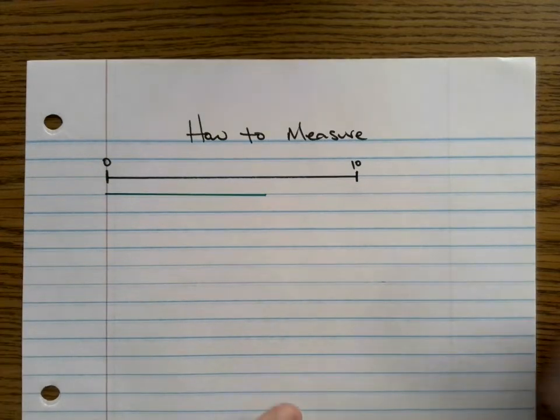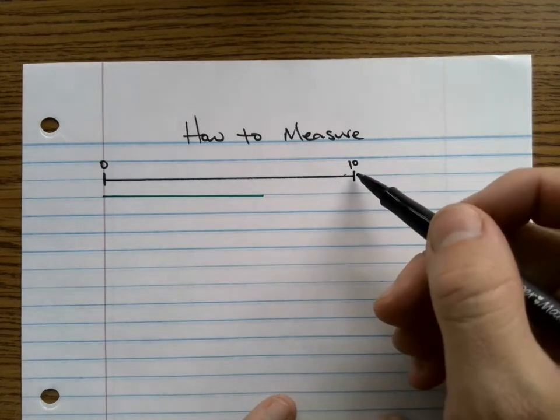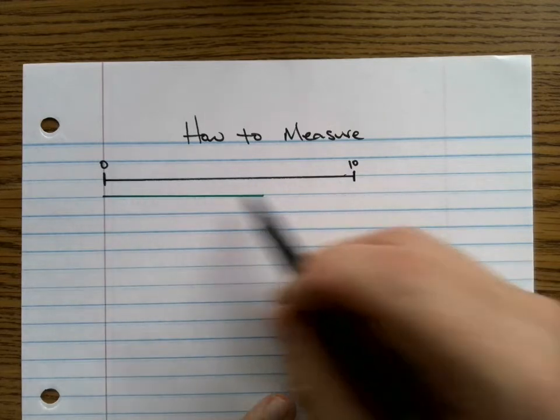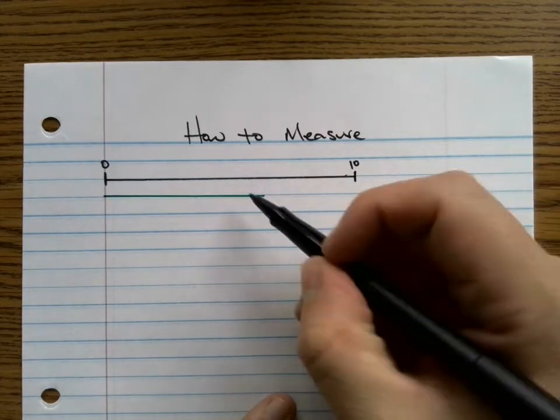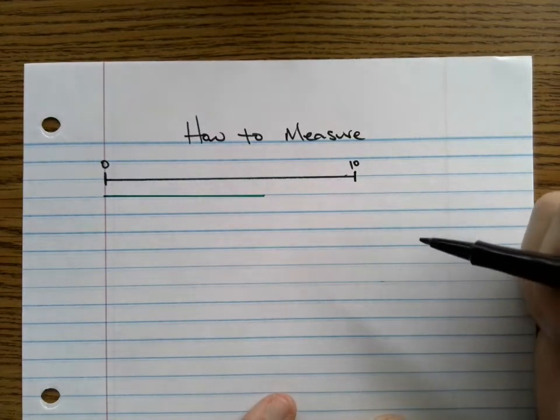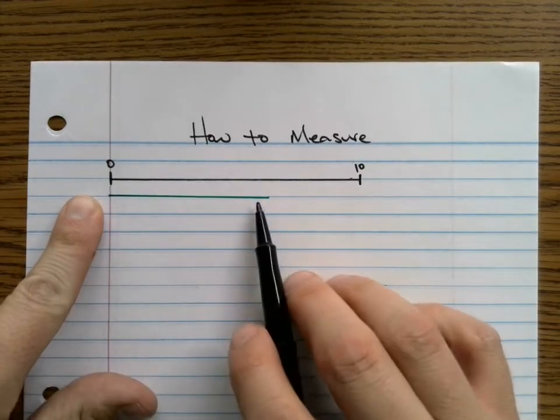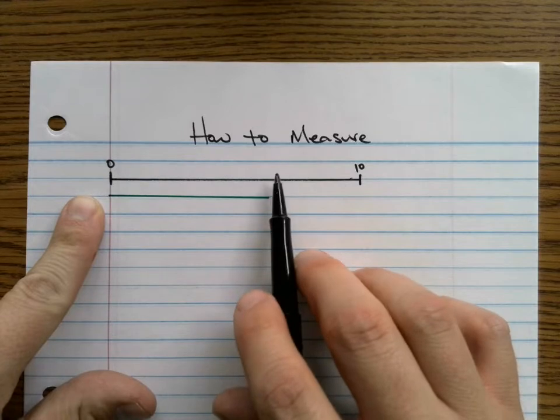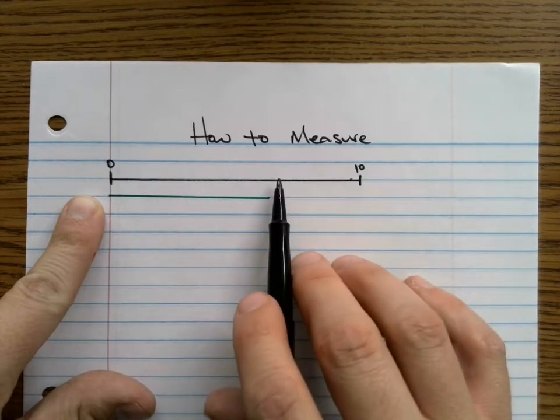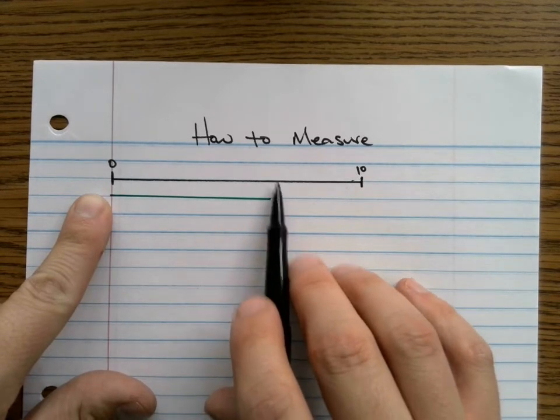And there's a couple ways that we can measure this. We could say it was either 0 or it was 10 because those are the only certain digits that we have. What about how could we divide this up to kind of guesstimate where this is? We could do it in halves, we could do it in quarters, we could even do it in thirds. But the way we want to do it in the lab is in tens. So if we think about from 0 to 10, where would this line be? What if there were hash marks here that said 1, 2, 3, 4, 5, 6, 7, 8, 9, 10, where would it land? And I would assume that this line would land probably around 6 or 7.